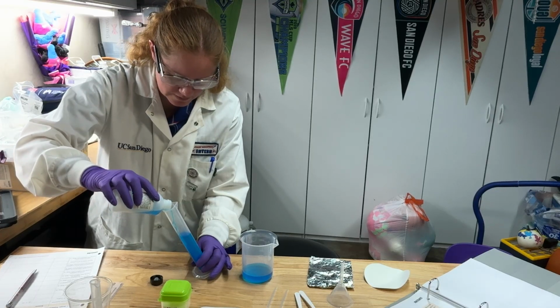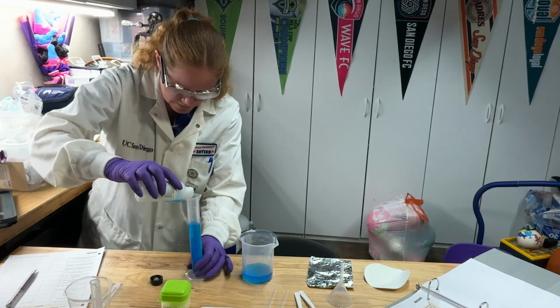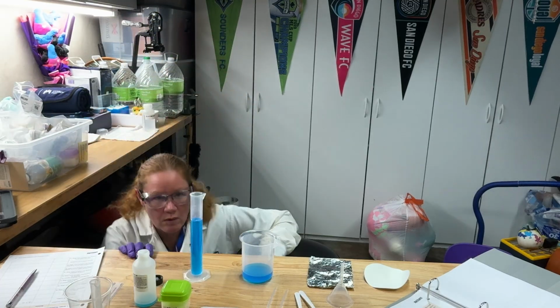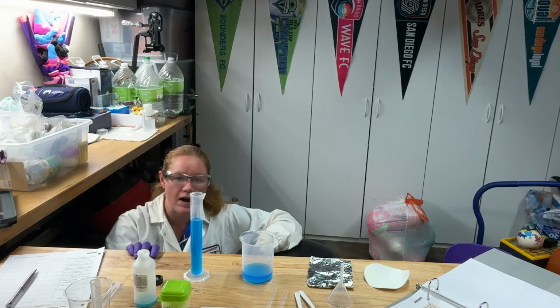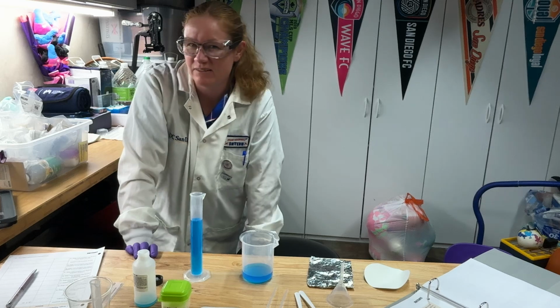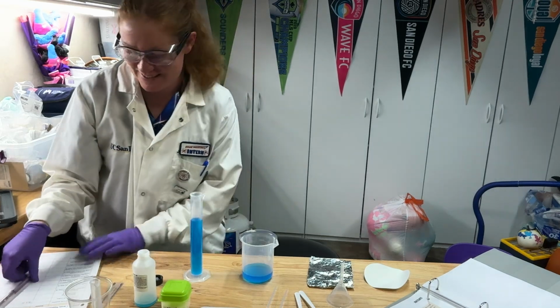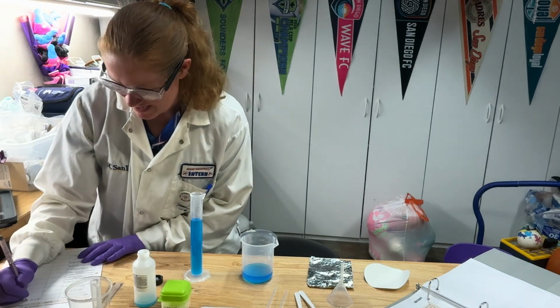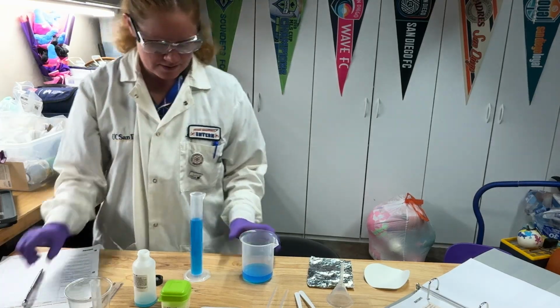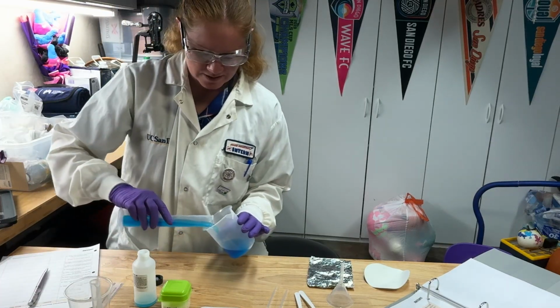It looks like, okay, I'm not going to go all the way. Oh, I got that right on the 50 mark. So if it's right on the line, do I just write 50 down? No, I'm going to write 50.0. I'm not going to lose my sig figs. All right, so I'm going to write 50.0. Pour that out.